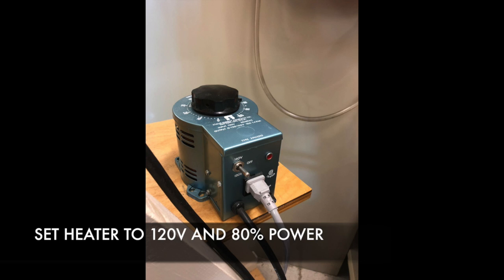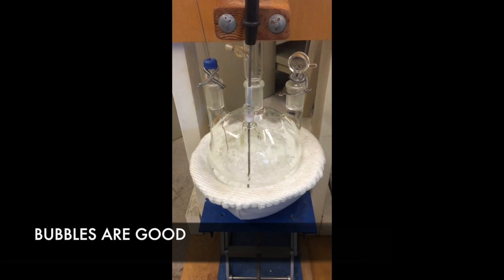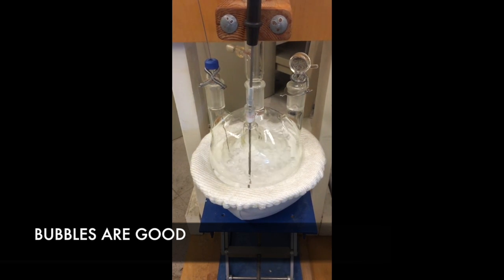Once the heat has been on long enough, you will begin to see the temperature increase on the thermocouple. Watch temperature closely, because if it goes past 85 degrees and there is no formation of bubbles in the reboiler pot, immediately notify your TA, as this can lead to superheating and cause the glass to break. Definitely don't want this happening. As you can see here, we had no problems with this, as we got bubbles.